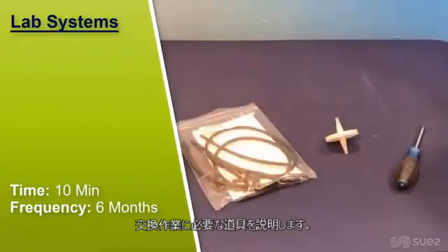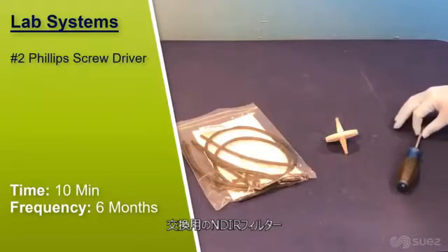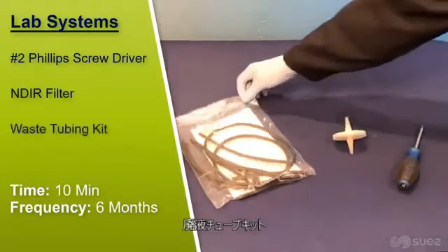To replace the NDIR filter and analyzer waste tubing, you will need the following: a number 2 Phillips head screwdriver, a new NDIR filter, and an InnovOx waste tubing kit.